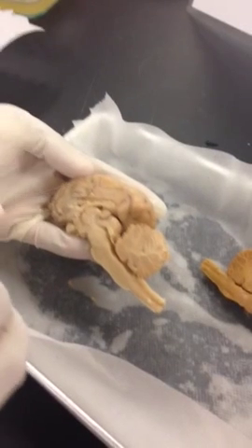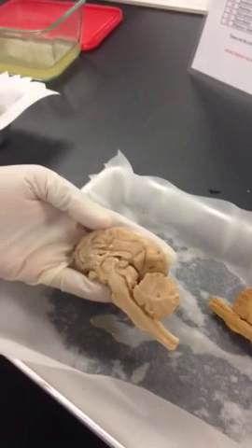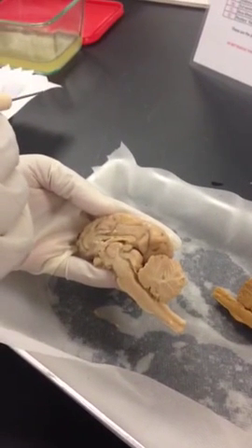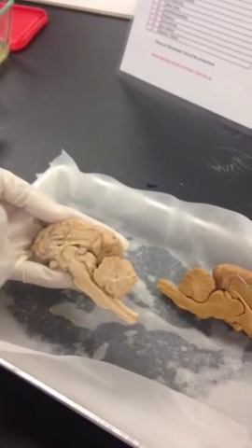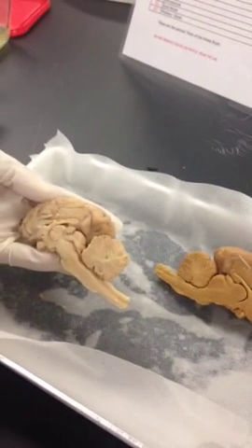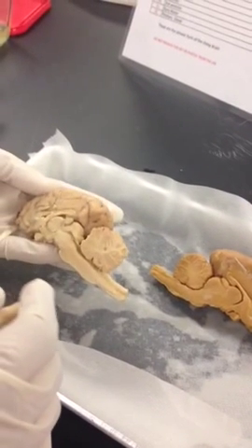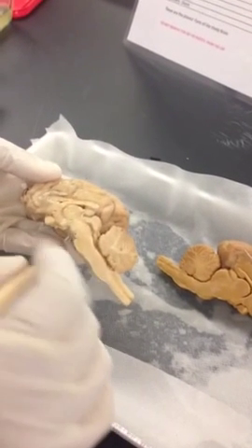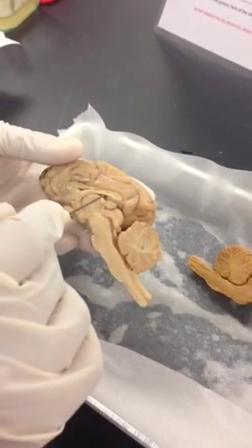There's a picture in your book in another page that shows the pathway of the CSF. If you turn around under the meninges, you will see that. What page do we have, Esther? 194. Yeah. So if you want, you can take a look. Then we are going to do more structures in the midbrain.